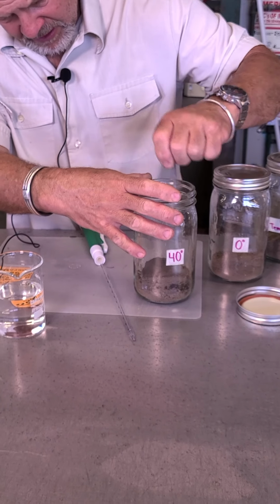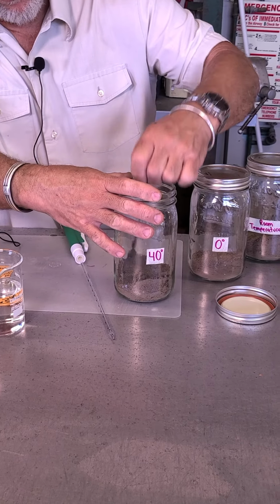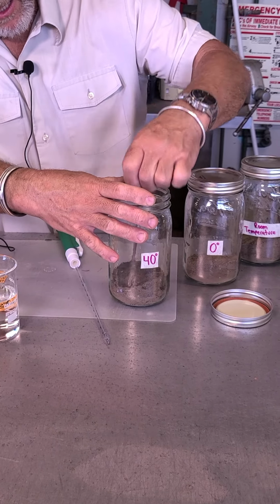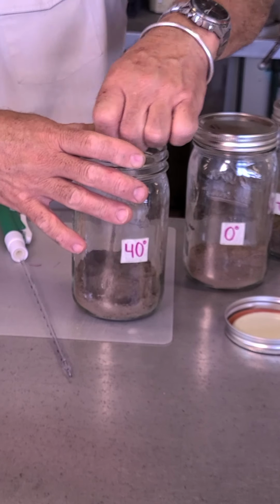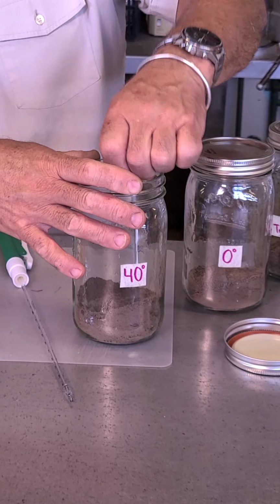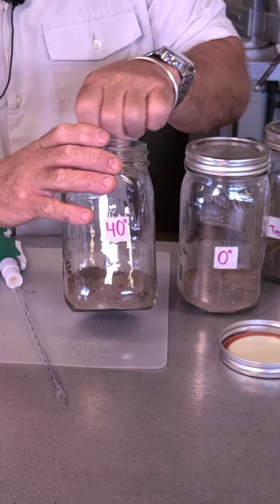I want to get some moisture in there. I want to give these microbes the opportunity to be happy. They're going to sit in here for at least a week before I do anything. So I want their environment not to be dry, but to be somewhat moist, so that whatever living they choose to do won't be limited by the fact that their soils are bone dry. So that's 30 in there. I don't think that's enough.